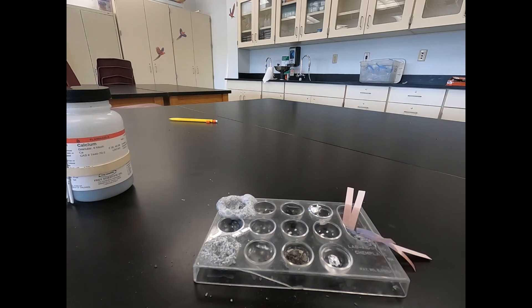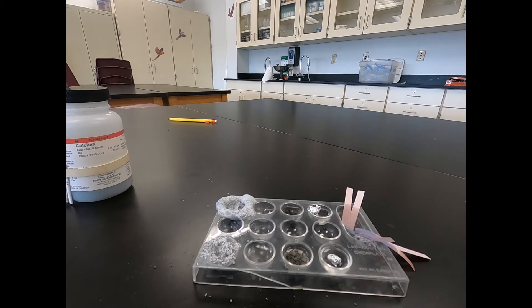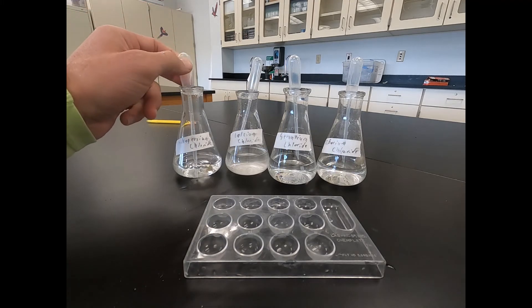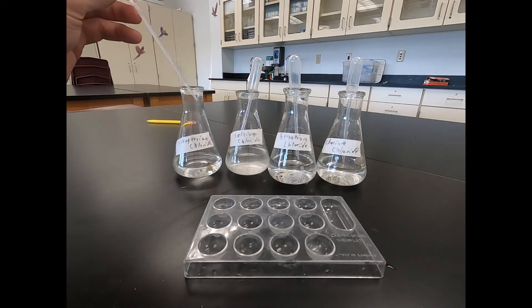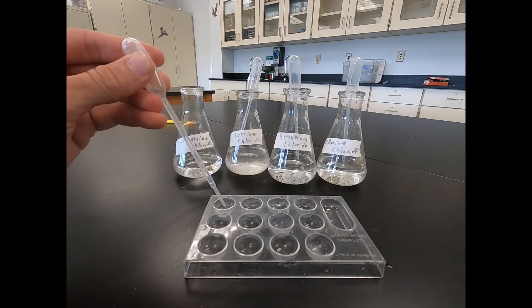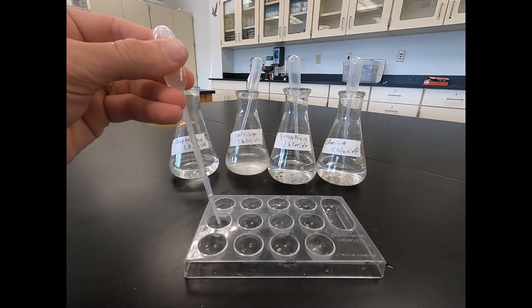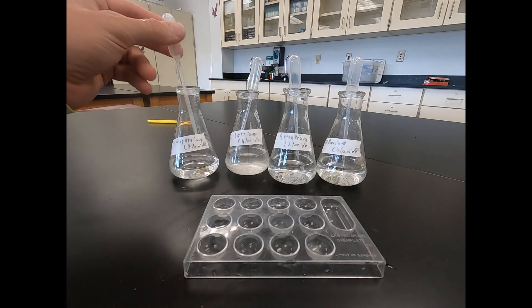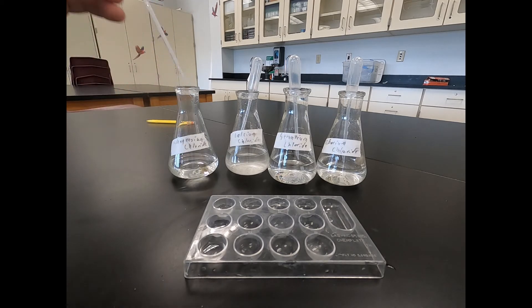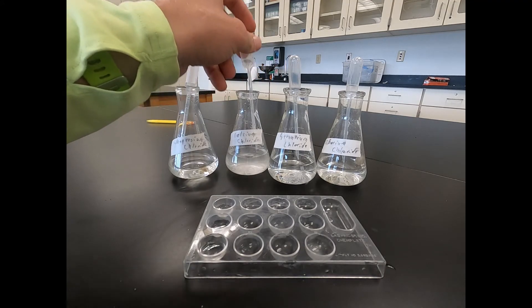Next portion, we'll move on to reacting our alkaline earth metals and chloride compounds. In this portion of the lab, we're just going to set it up for our reaction. We're going to use each one of our alkaline earth metal chloride compounds and we're just going to set up three well plates about one third full with that compound. So the first one's going to be magnesium chloride, and we're just going to do that same process for all 12 of these spots, so each one goes in three spots. We'll catch you after we get these filled and start putting the testing solutions in.